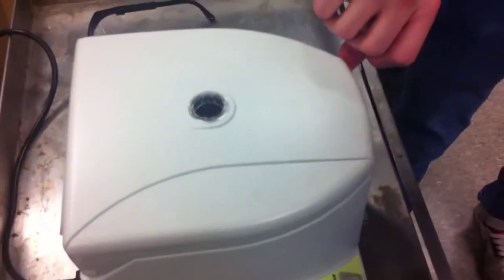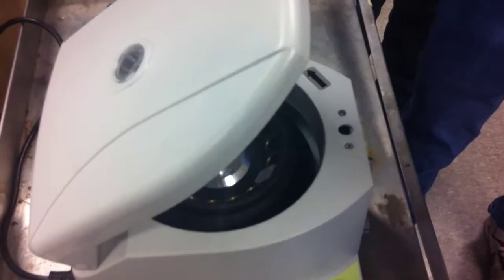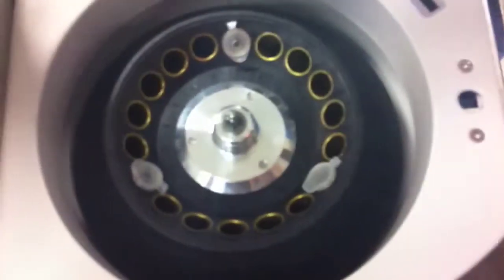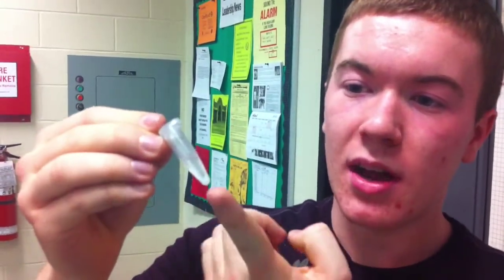This is a safety precaution taken in order to ensure that accidents don't happen. Now we can see the supernatant of ethanol surrounding our nice white pellet of strawberry DNA.